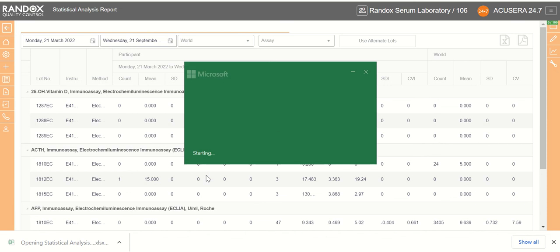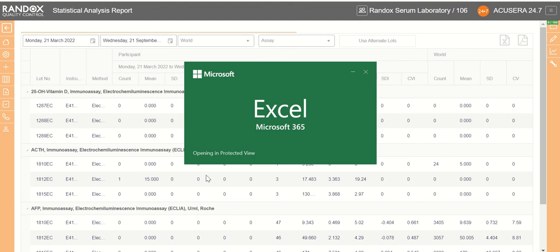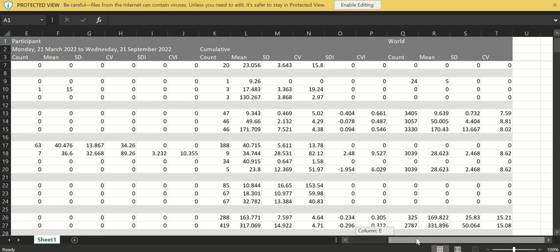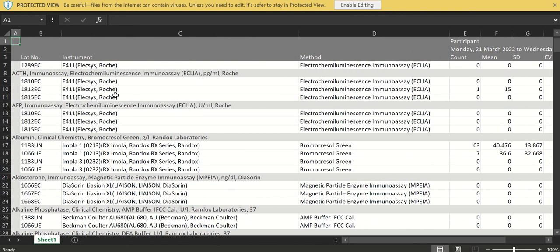If we open up this file, sorry, it's just taking a wee minute. Then we're given an Excel file showing all of the data that was being generated, including all of the statistics that were included in it also. This is handy for archiving purposes and for auditing.